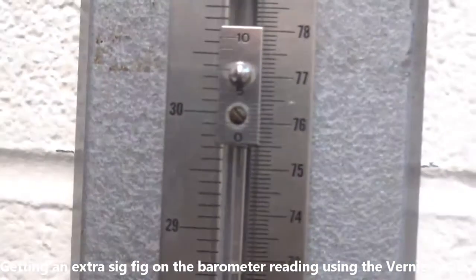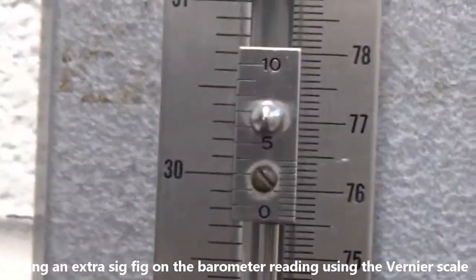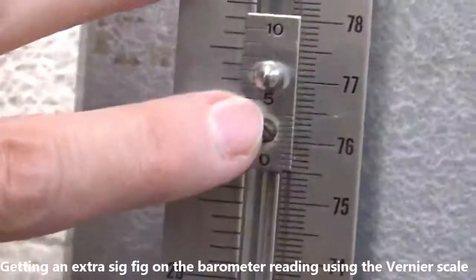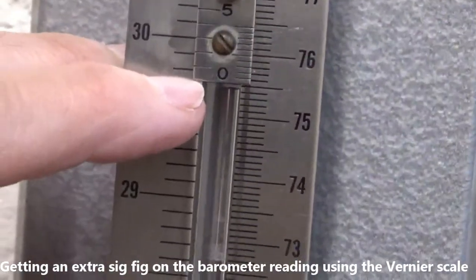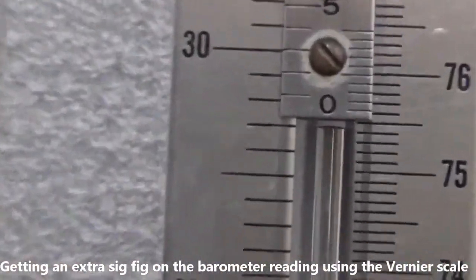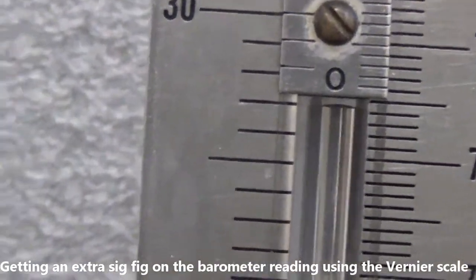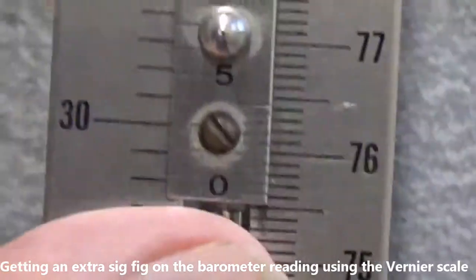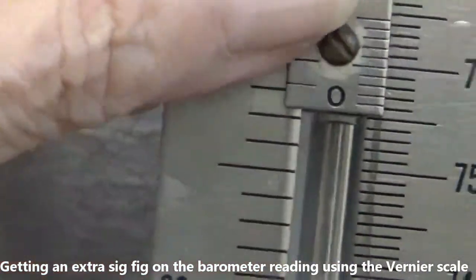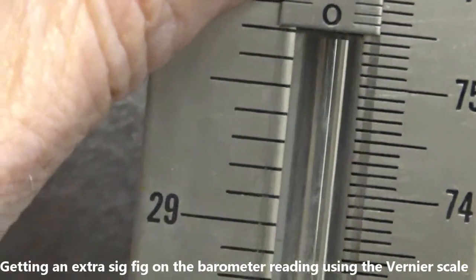So now what I've tried to do is line up the bottom of this little device here with the top of the meniscus, and I could get a third decimal place. Let's see. I think I'm a little off on the vernier. It's funny, it's magnified in here. It's actually easier to see. There we go.